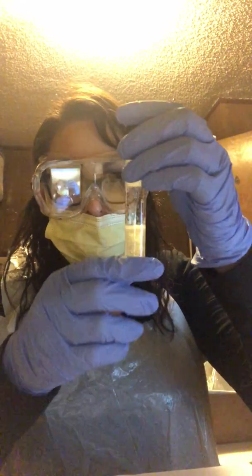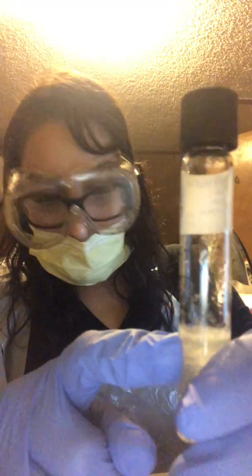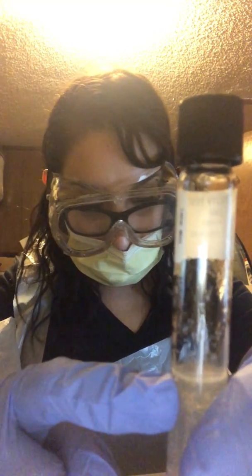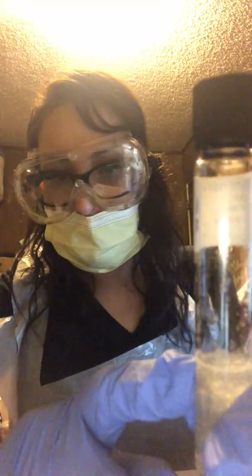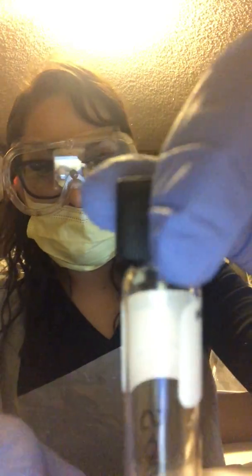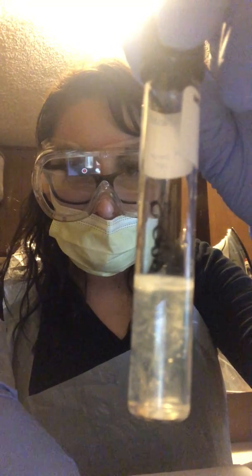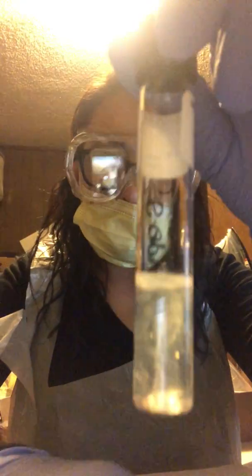So for E. coli, there's a line right there. So a clearly defined stab line and clear agar is a negative result. So you can see it right there. This line, perfectly fine. So this would be a negative result. And then this is the S. epidermidis. You can also see a line right there. And so it's clearly defined, I feel, so it's also negative.